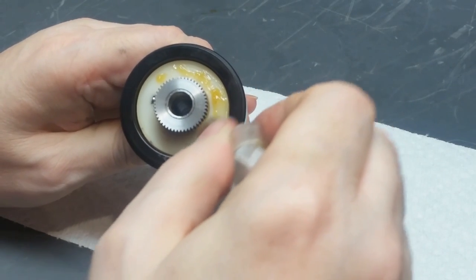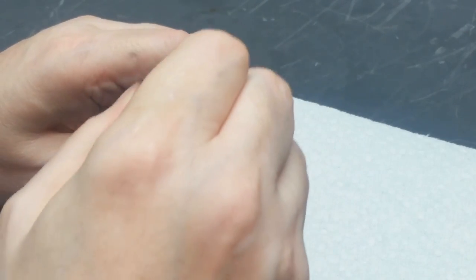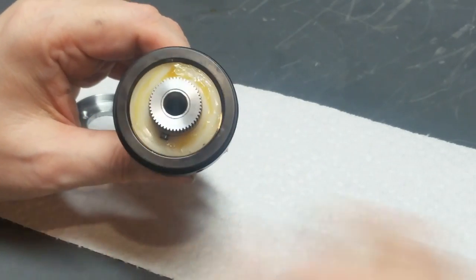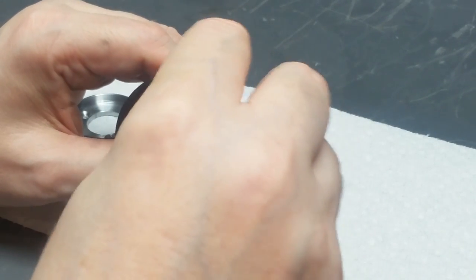This little nylon thrust washer here, this is the old style. The newer scopes use a very similar washer, except the newer washer is flat on the back and has a groove around the outside. So on the newer style, you would do the same thing, but you would make sure to fill the grooves up. That gives it a little bit of a reservoir for the grease.